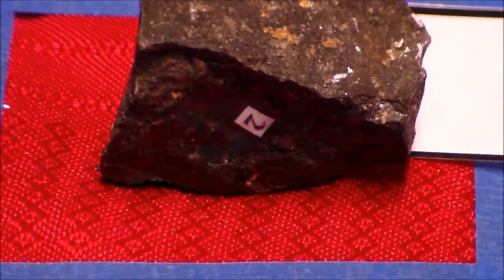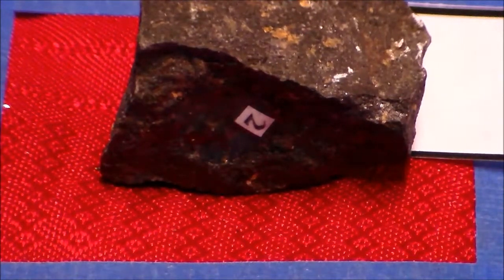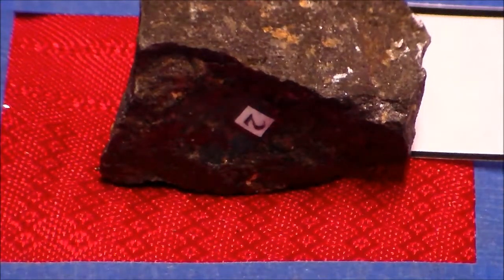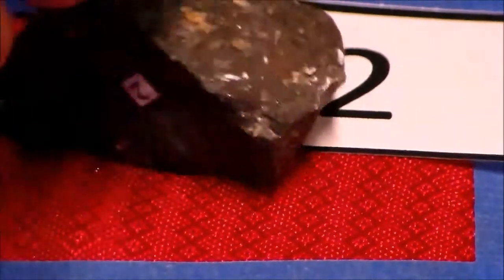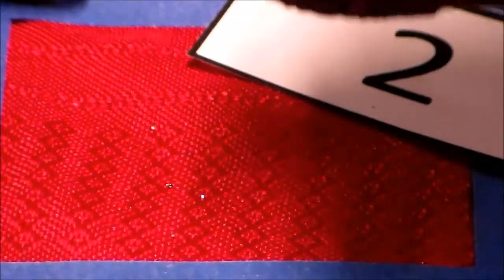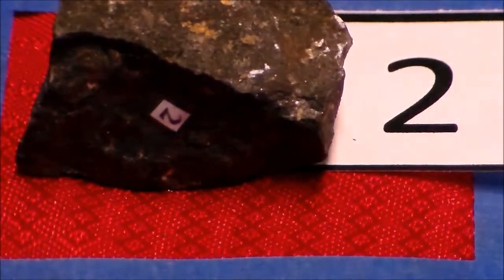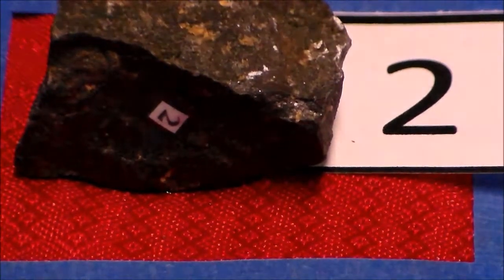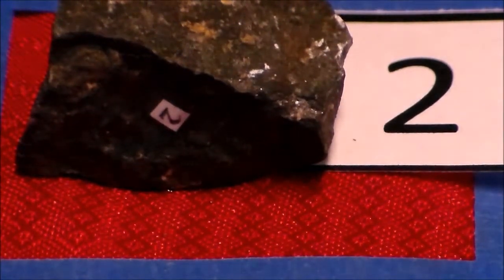Inside our mineral information table, if we look at the metallic luster, we've got one that says it's strongly magnetic. And this one is indeed strongly magnetic. So that's a property that we can use. It says it has a hardness of 6. Well, if it has a hardness of 6, then it should be able to scratch the glass plate.